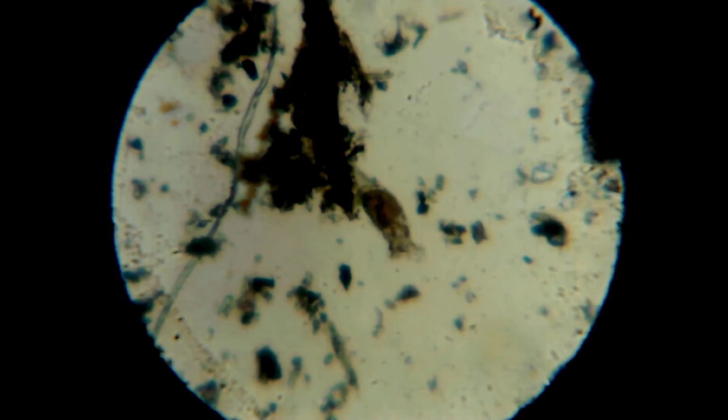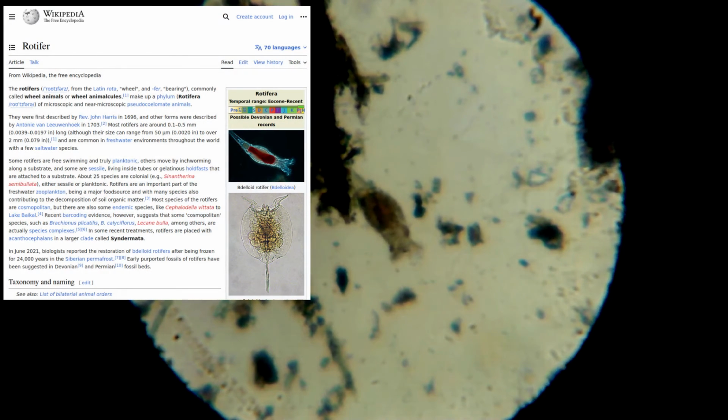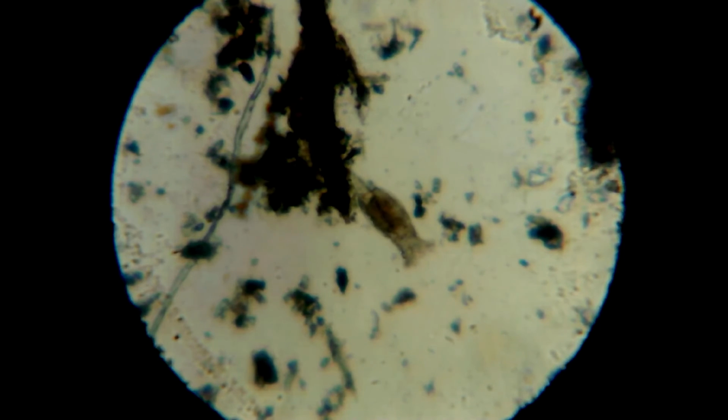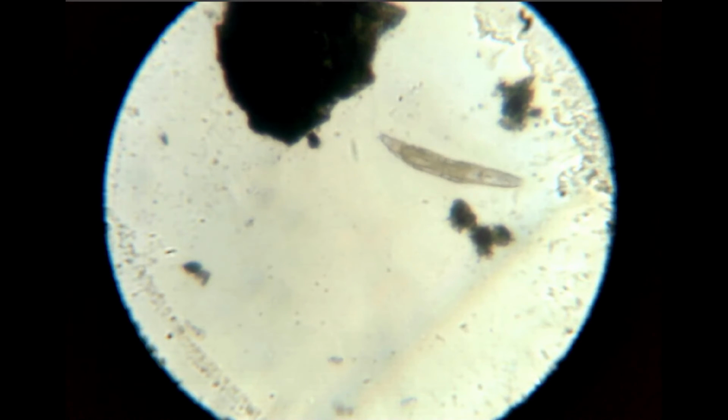An organism that was much more frequent in my moss was this one here, a so-called rotifer. They have a wheel-shaped mouth and a visibly moving stomach that they use for grinding down smaller organisms, such as bacteria. They either attach themselves to objects and suck in bacteria, or they roam around in search of food.